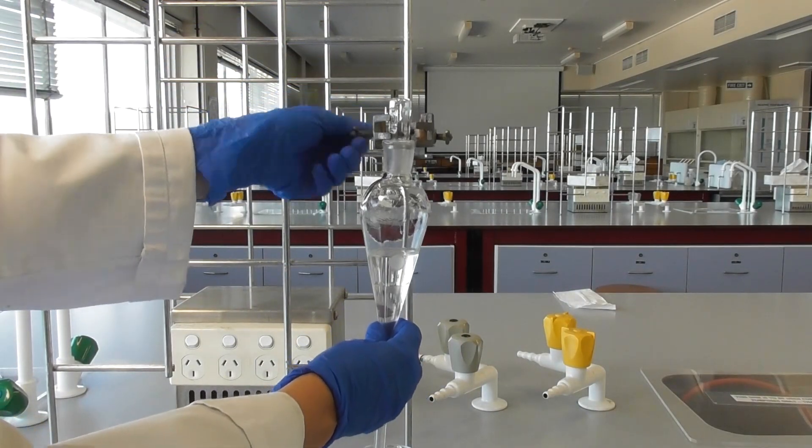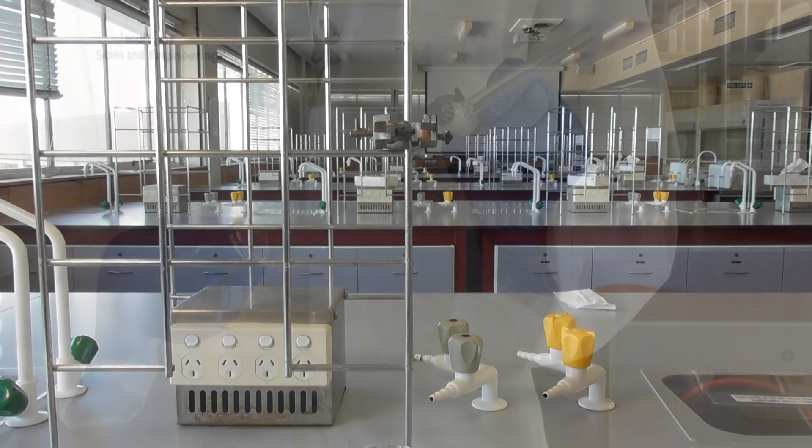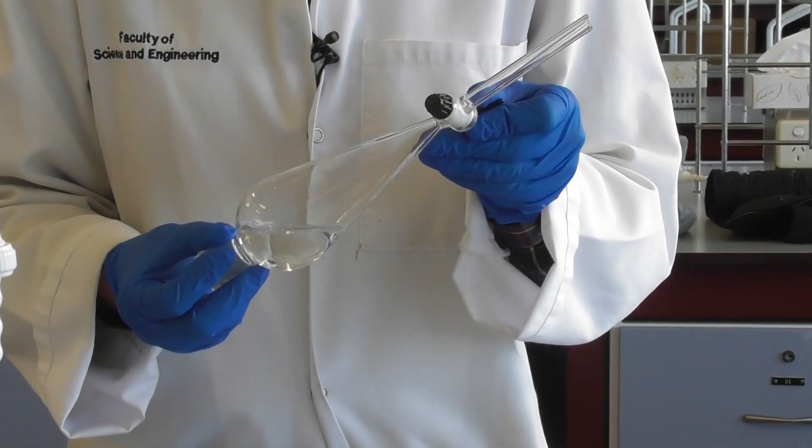Once visible reaction subsides, stopper the separating funnel and begin shaking gently, regularly opening the tap away from your face to release any buildup of pressure.